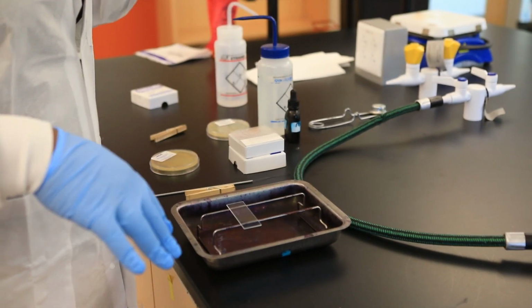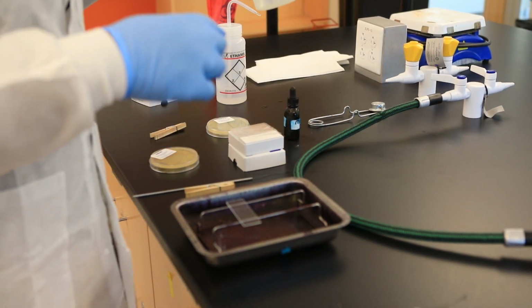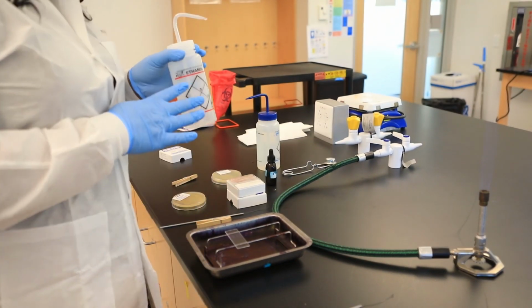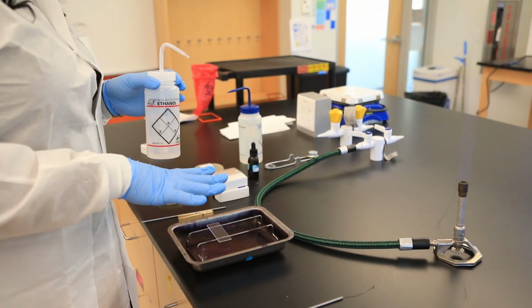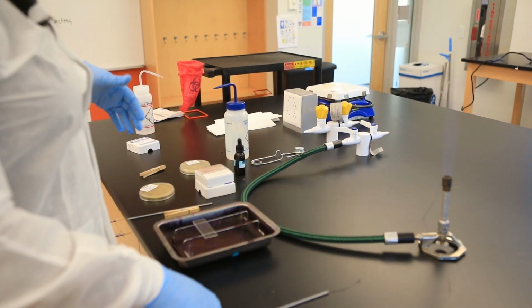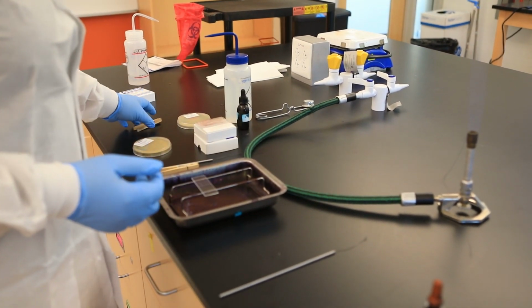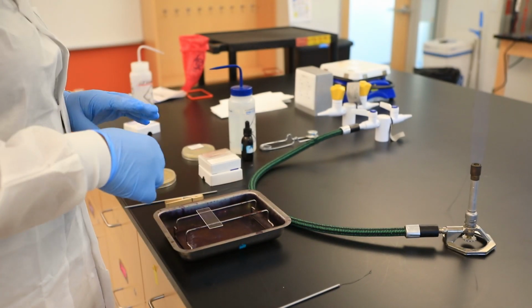If we were in person and I gave you a bottle or a tube or anything like that, you always make sure that you read the labels, okay? So here it says distilled water. This is 70% ethanol here, because we don't want to use 70% ethanol in this simple stain, right? We only use it to disinfect. So I'm going to push this over here. That's one good thing to do once you disinfect your area: place that disinfectant far away from what you're doing, okay? And then we have a clothespin just to make handling of the slide much easier, okay?